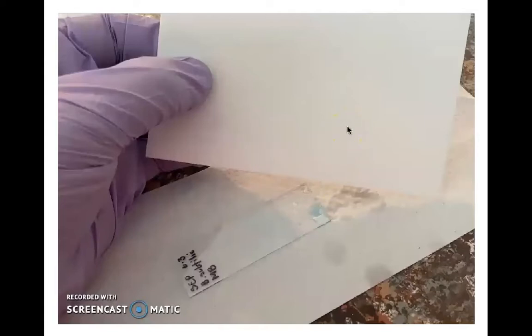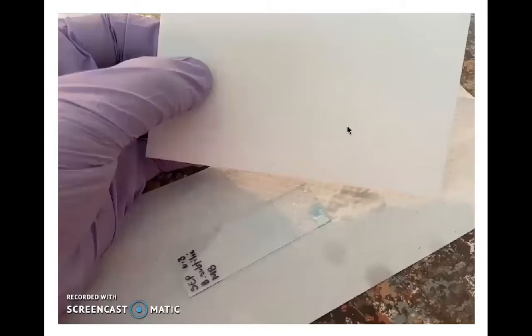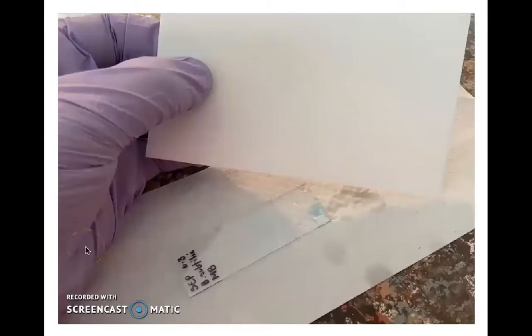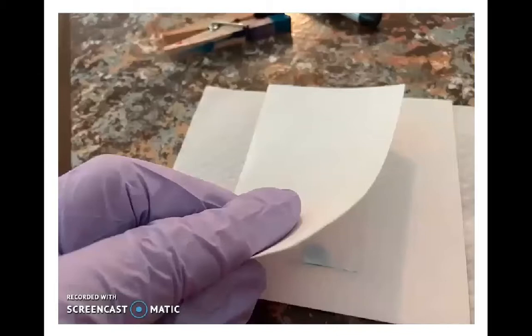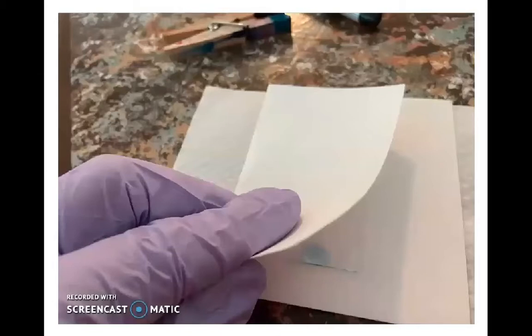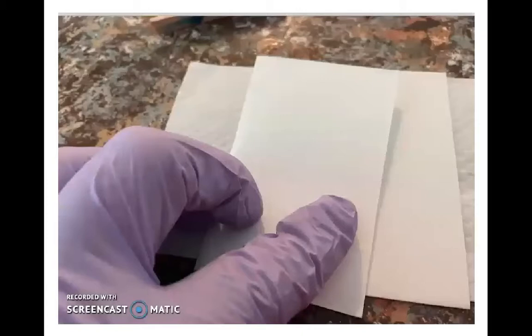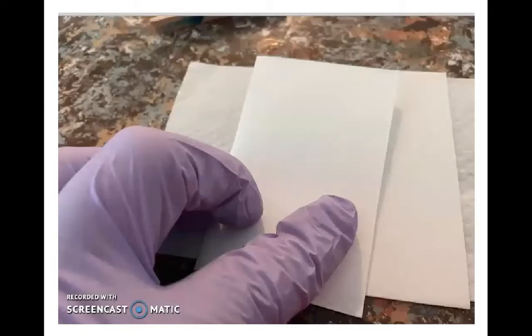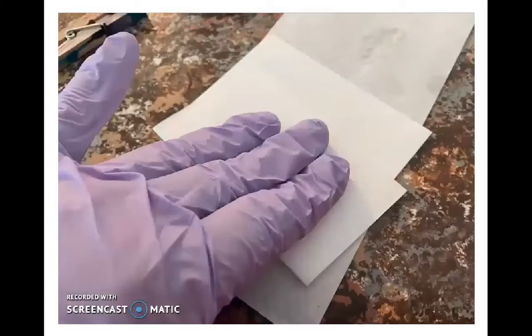You can allow the slide to air dry, or you can use bibulous paper — a thick absorbent piece of paper that comes in pads. Use one piece to gently blot your damp slide to get it prepared for observation under the microscope. Fold the bibulous paper over and gently press it down onto the surface of the slide to wick up as much moisture as possible. It's important to know you don't have to get the slide completely dry after staining — if it's a little damp that's fine. You don't want to rub the slide, just blot it gently to get up as much excess moisture as you can.